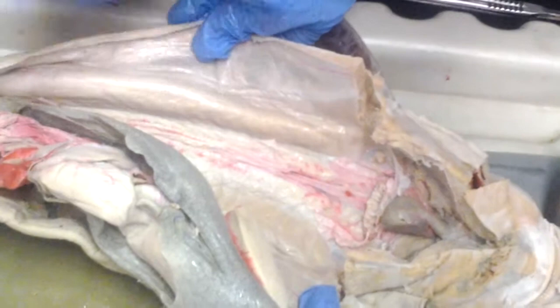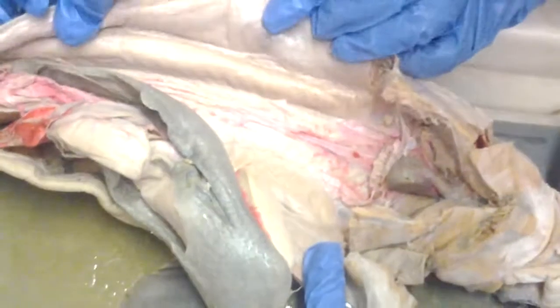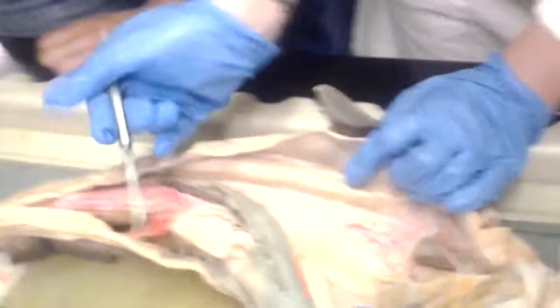These specimens are not very well stained, so you can't see it very clearly. Is that the only type of veins we need to know? No, you should know the hepatic portal and the hepatic veins. And the sinus venosus, just not for you.